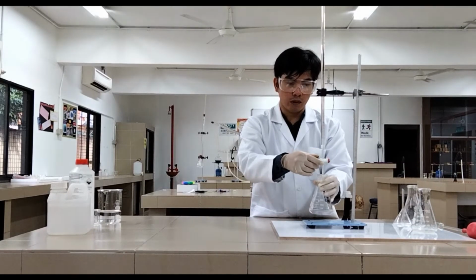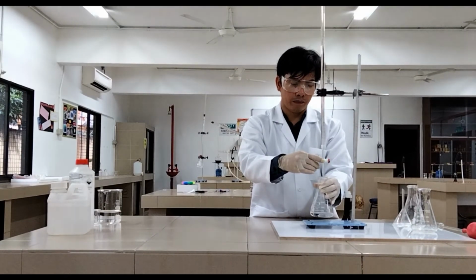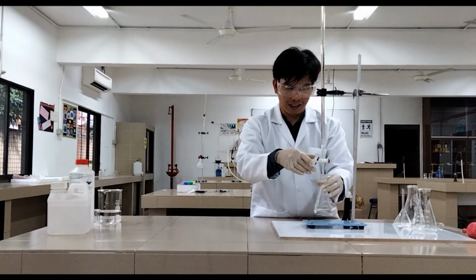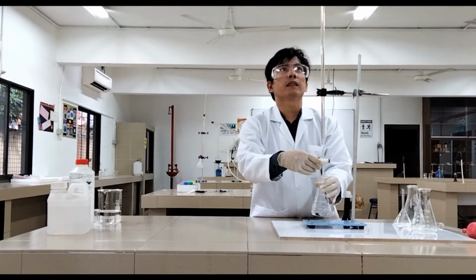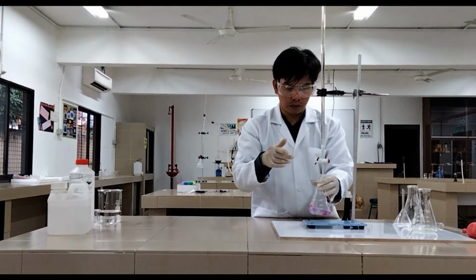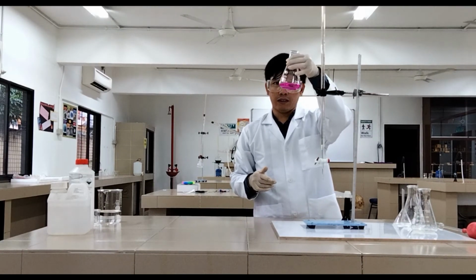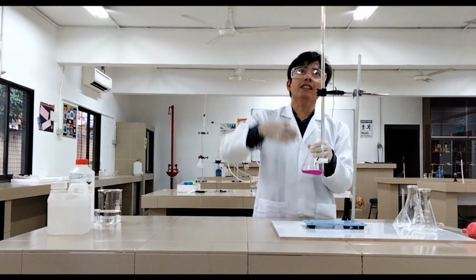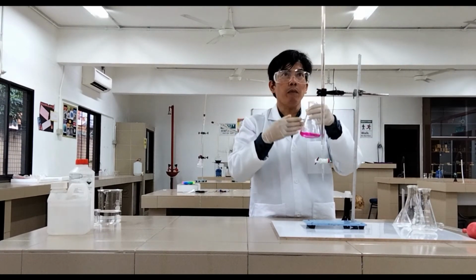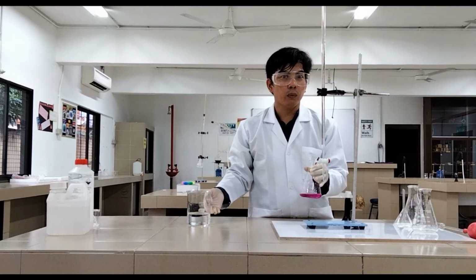Okay. See, it's almost not turning pink anymore. Then we just add 1 more drop. So again, it is 6 ml. 1 more drop. Okay, still not enough. So 1 more drop. This is 6.1. Just 1 drop. Okay, so it turns pink already. It's a bit like pink and colorless, in the middle of the two. Now we can say that the amount of sodium hydroxide we used is 6.1 ml of 1 molar sodium hydroxide, which is needed to neutralize this acid, of which we do not know the concentration.